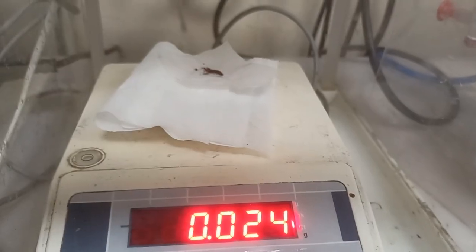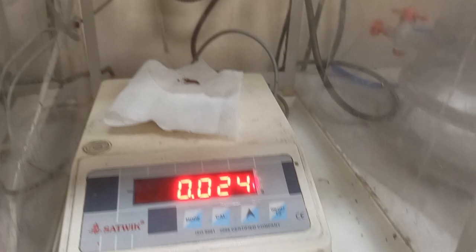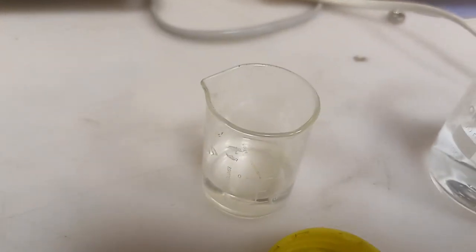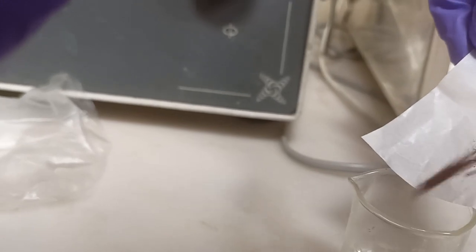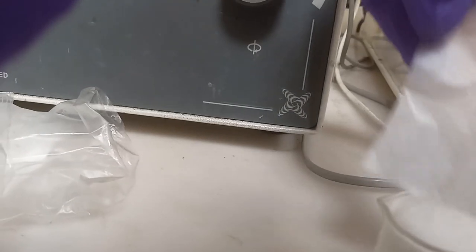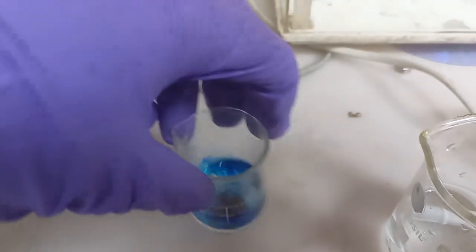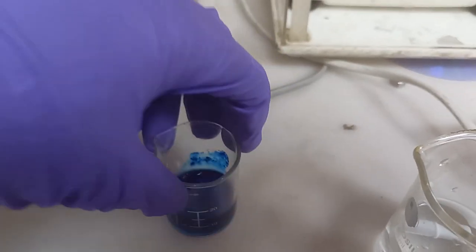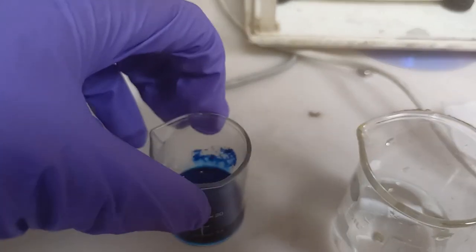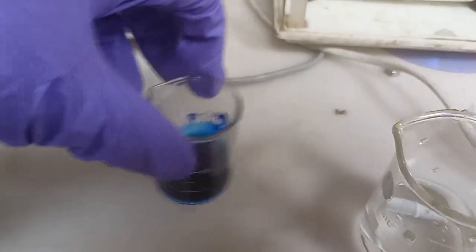I am taking around 25 mg of Methylene Blue and mixing it with my 10 ml of water. Let us see what happens. Now I need to mix it thoroughly and that will be my master solution.